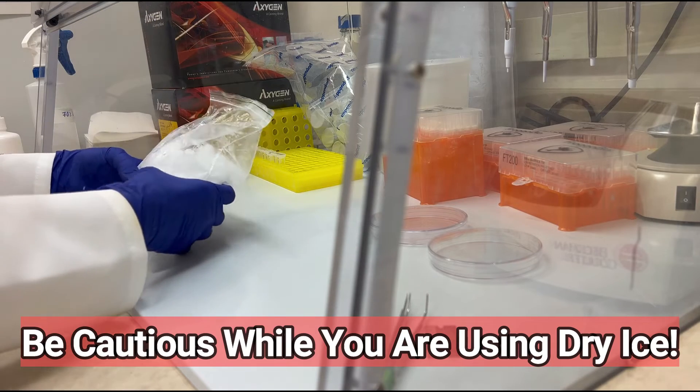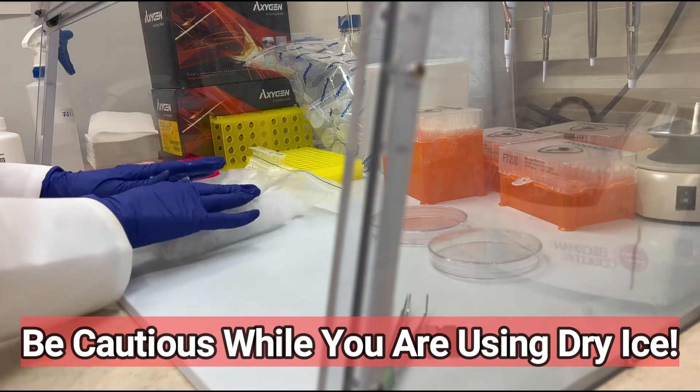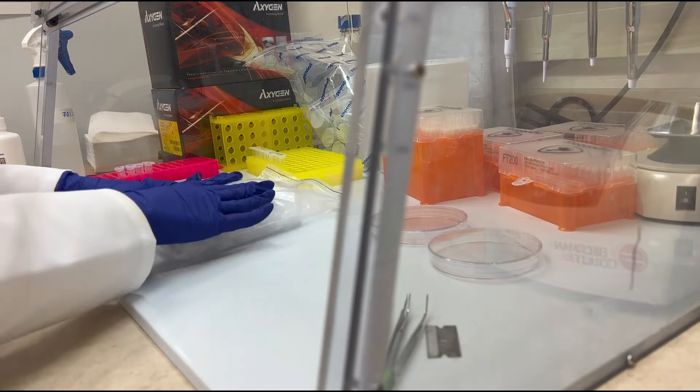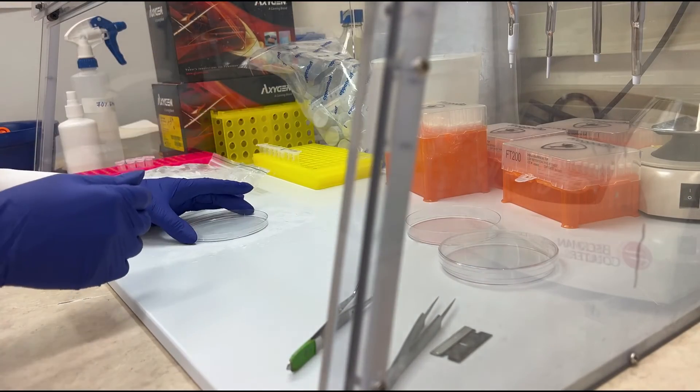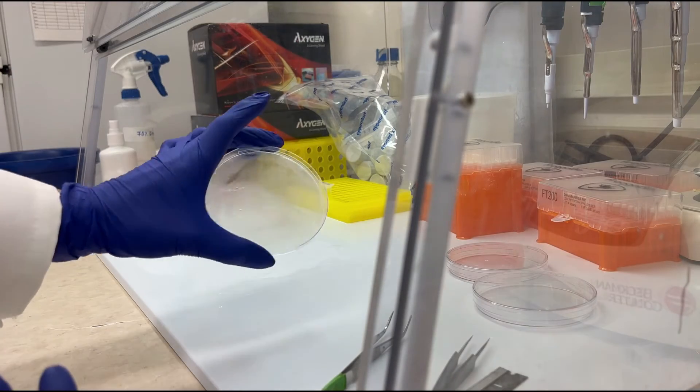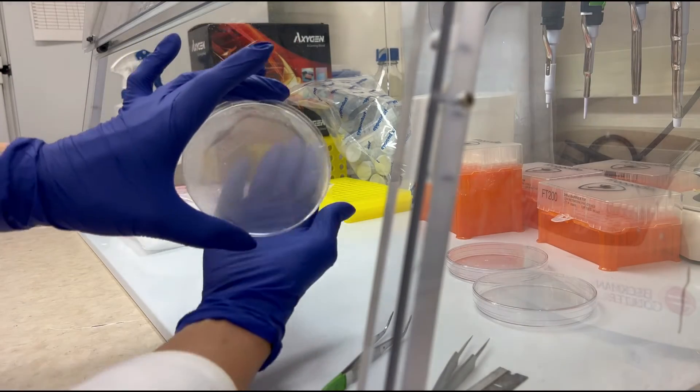...simply position the dry ice bag on your workstation surface for approximately five to six minutes. Place your petri dish on the cold surface under the dry ice. This chill environment will make cutting your tissue samples a breeze and can prevent RNA degradation.